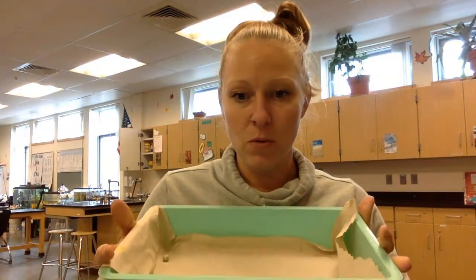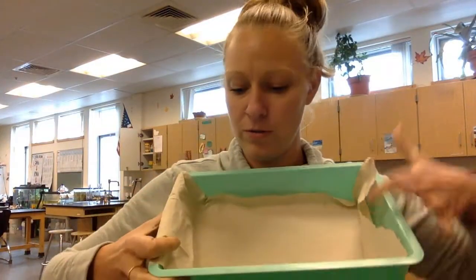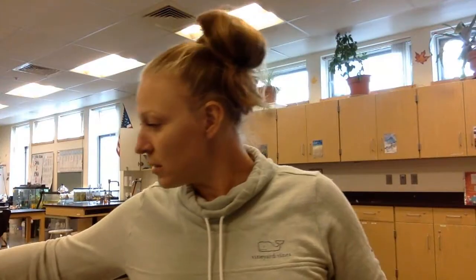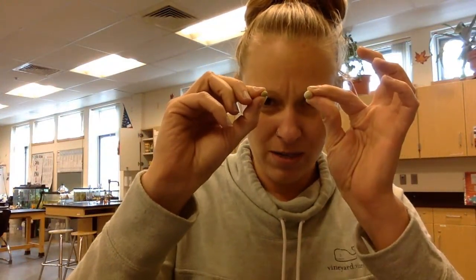What I did yesterday was I had quite a few more peas. I put some water on them and I let them sit in the water for a day, and if I were to let them sit in the water for just a little bit longer they start to sprout and grow, so they are beginning to germinate. Here is a germinated pea and this is a dried pea, and you can see there's quite a difference in size — this one's already starting to grow.